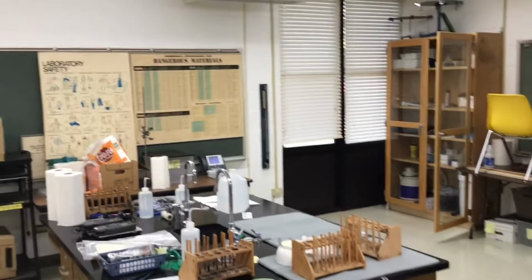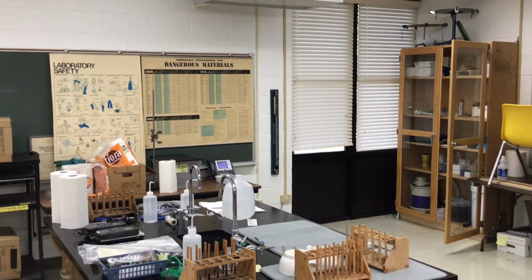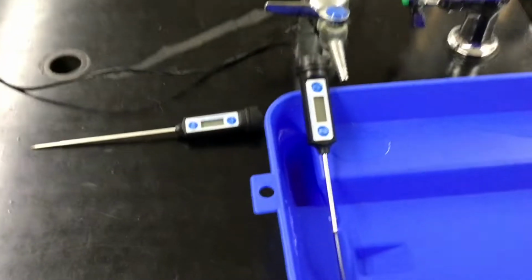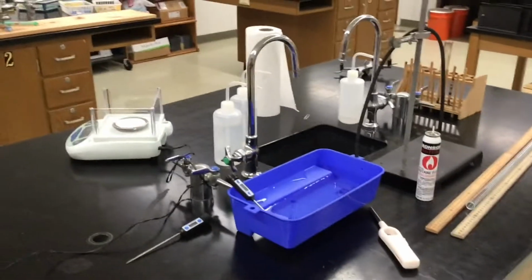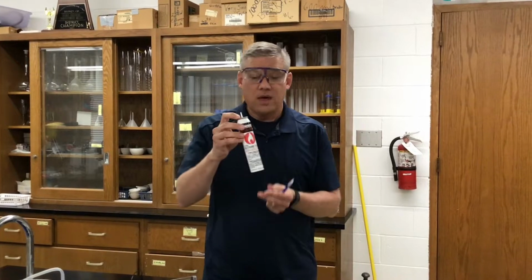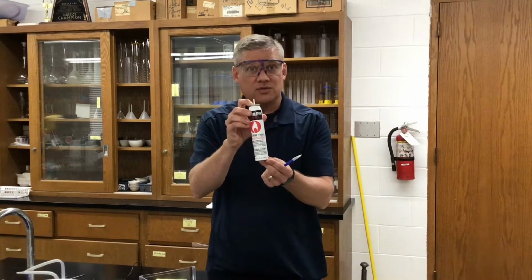We'll read the gas pressure with the barometer, using Dalton's law of partial pressures and the water vapor pressure. At this temperature, we'll read the volume with the eudiometer, and we can find several things. First of all, find the moles. And my students will video this later this day. Okay, we are going to find the mass of gas released from this canister.